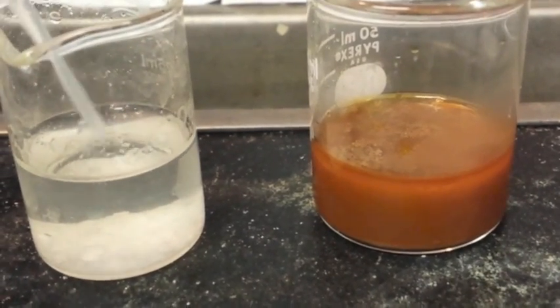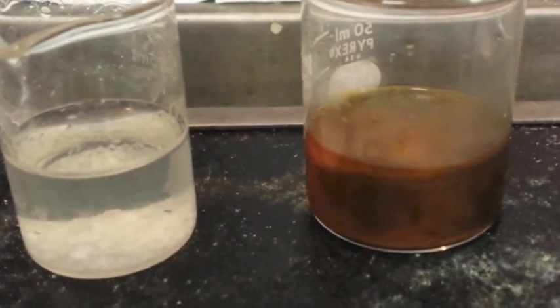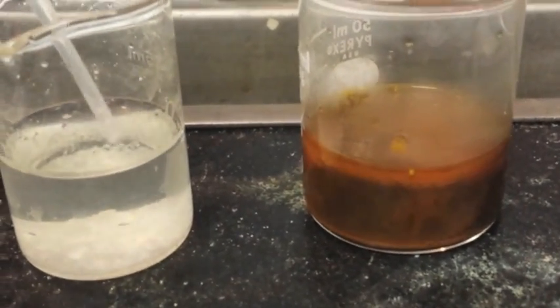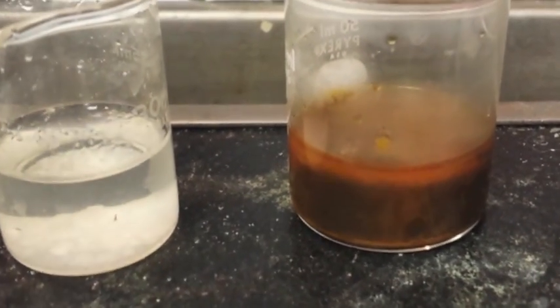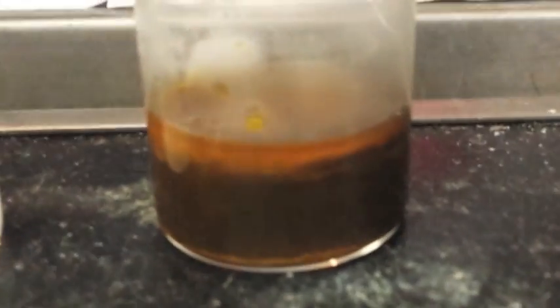Do not stick metal in this. Again, this is an acid. It will bind to anything you touch, especially your fingers. I think you can see it turning completely black. This is gold in the solution.